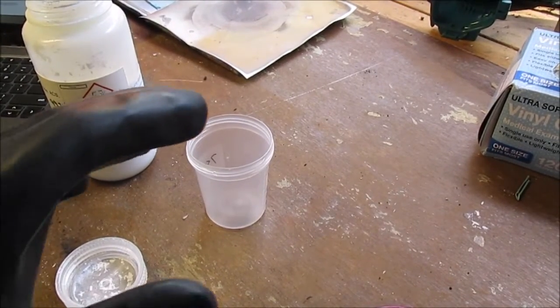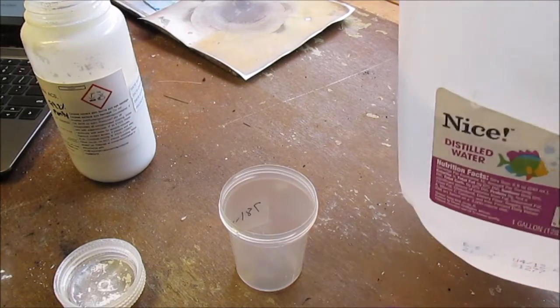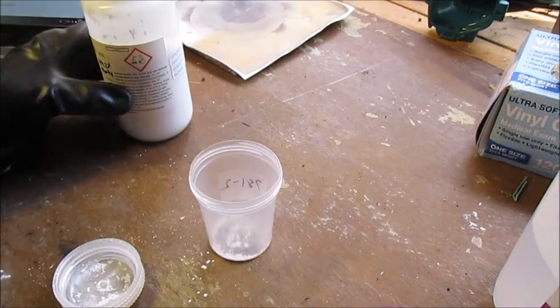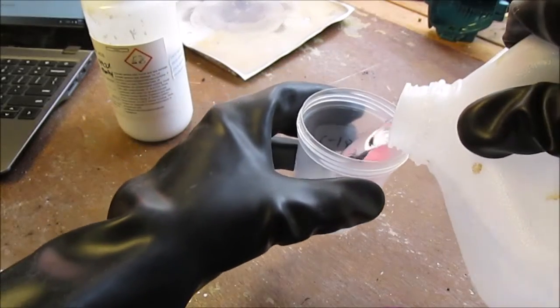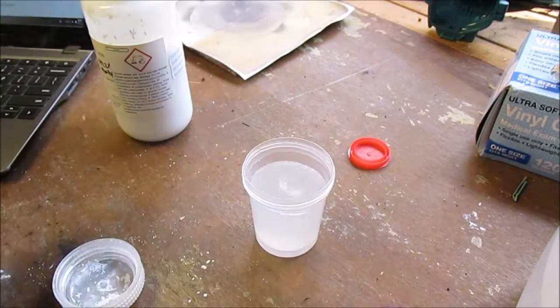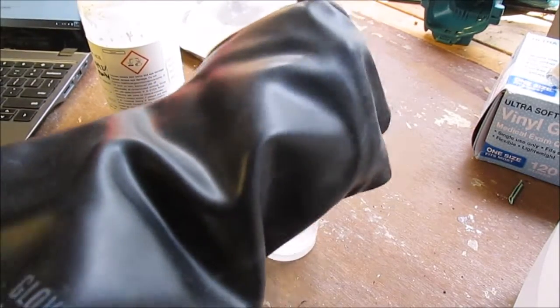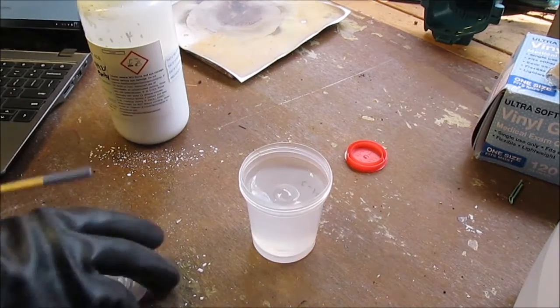Step one: I'm just going to take a little bit of calcium hydroxide, put it in a small vessel, and dissolve it in water so the solids can react with each other and give that nice visual appeal. Just a little bit of calcium hydroxide — this stuff is not very soluble at all. Even in this small cup it doesn't dissolve very much; it's nearly insoluble in everything, which is kind of a shame because it does some cool reactions.